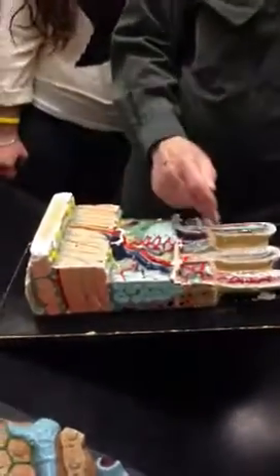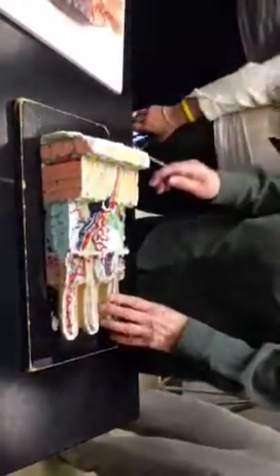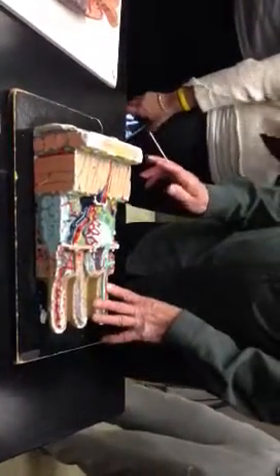One other thing, the gray stuff. Anything gray you see on these pictures, that's connective tissue. It's got a specialized name. What's the name on there? Serosa? No, not serosa. Serosa's out here. Lamina propria, L-A-M-I-N-A P-R-O-P-R-I-A, two words. Lamina propria. Anything gray, call it lamina propria. It's connective tissue.